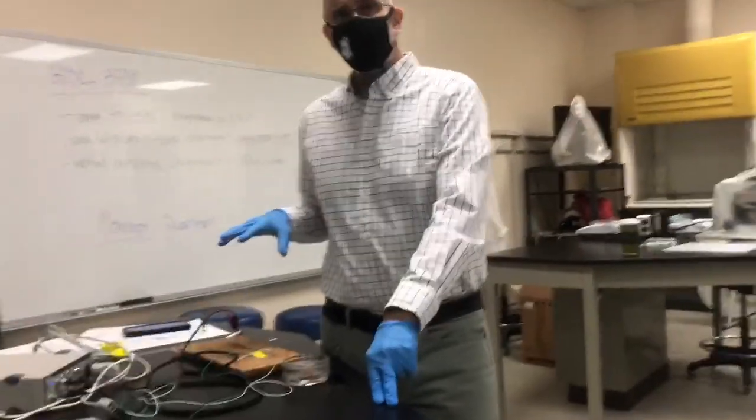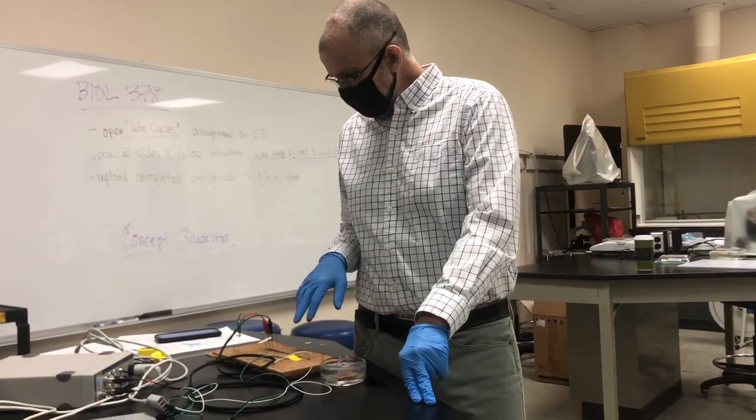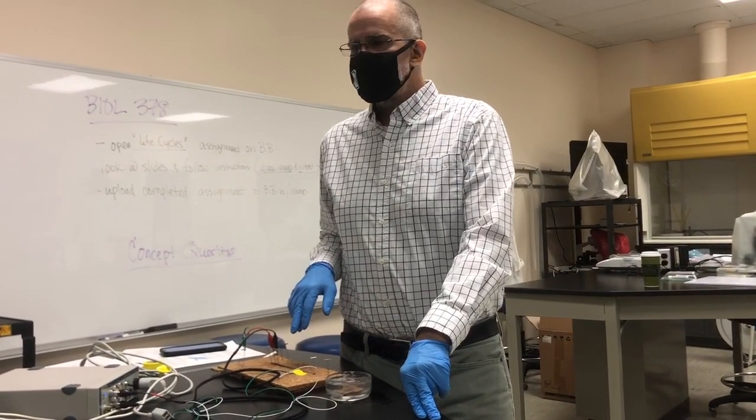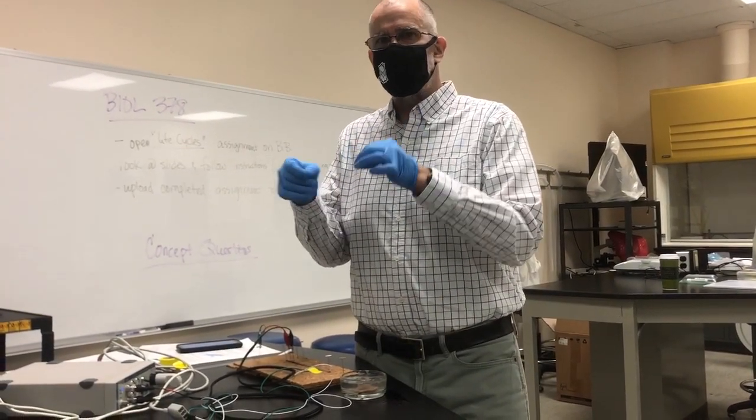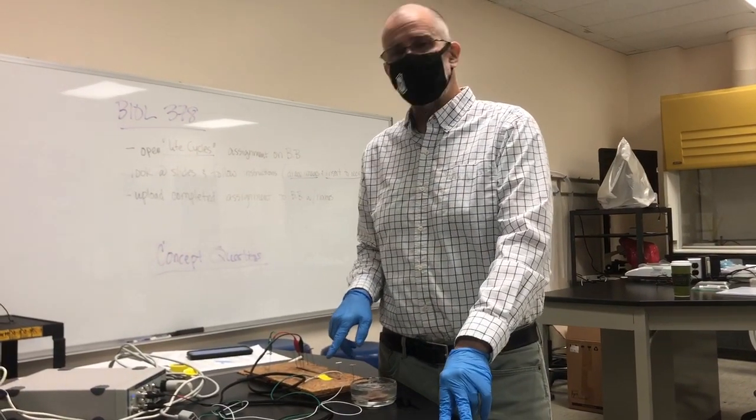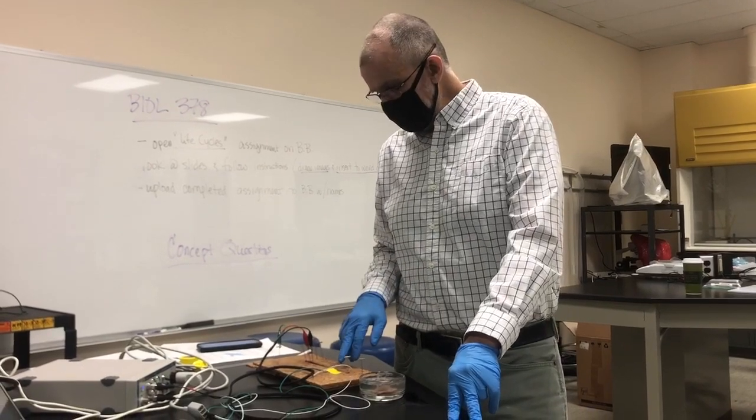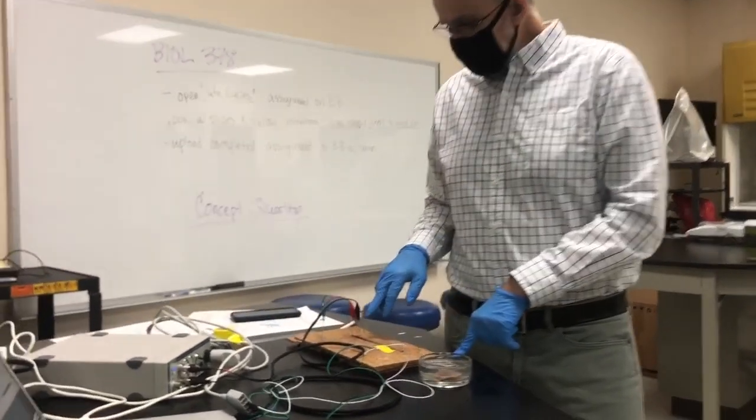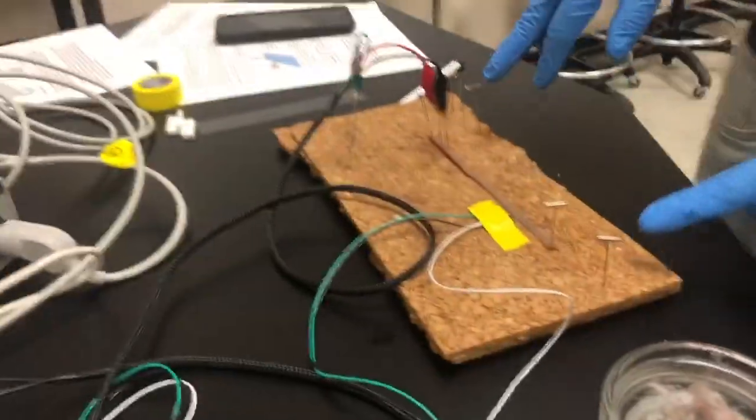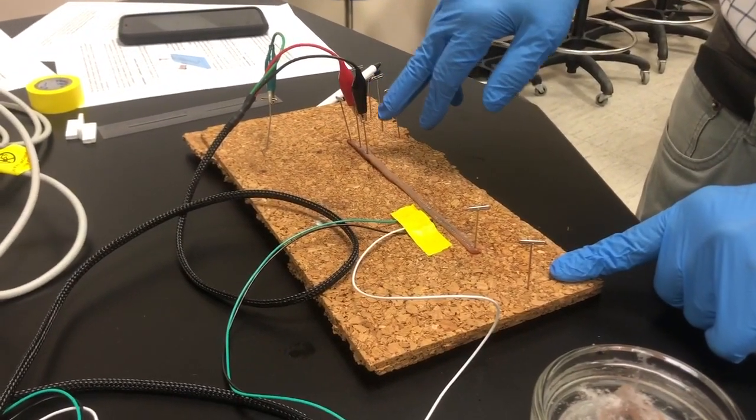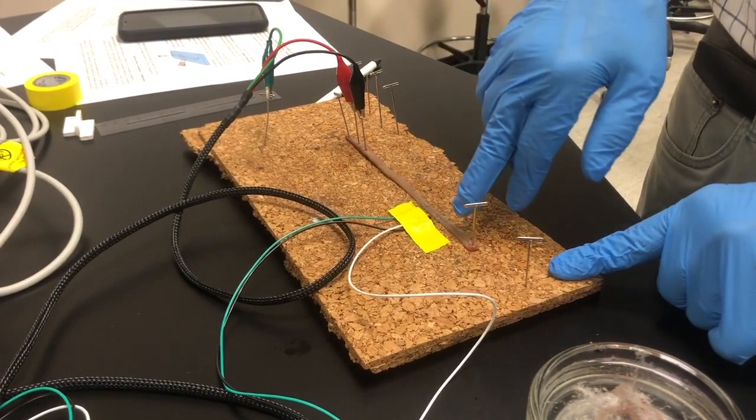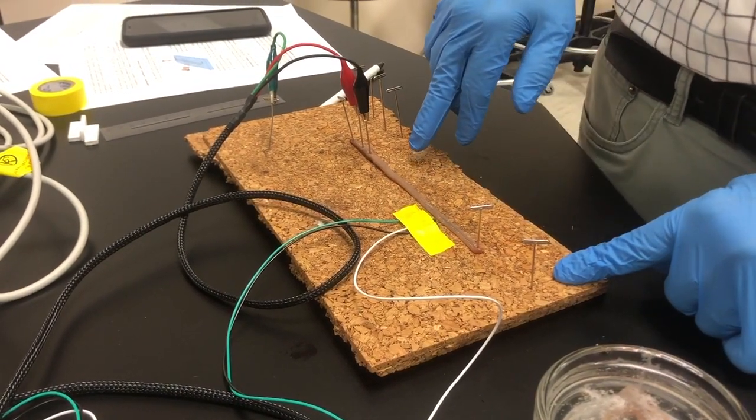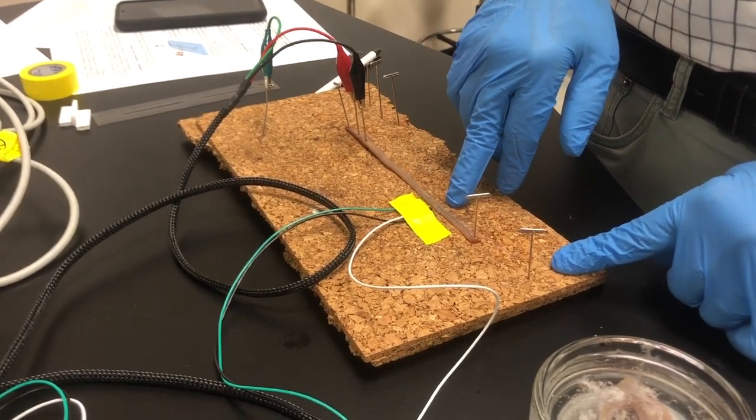Today we're going to look at a surface recording of an earthworm action potential. We don't have to plug electrodes into an axon of a giant squid. The signal is so powerful you can actually get a facsimile of it just by putting electrodes on the surface. We have our earthworm laid out here, anesthetized with alcohol, with stimulating electrodes that will stimulate the medial axon running down the ventral surface of the worm, plus a ground electrode and some recording electrodes.